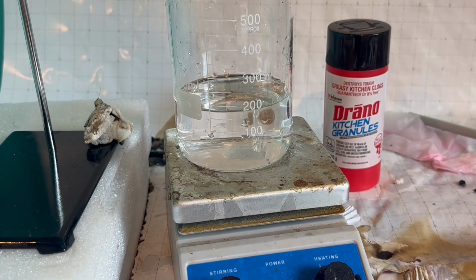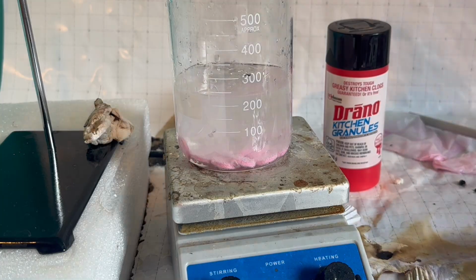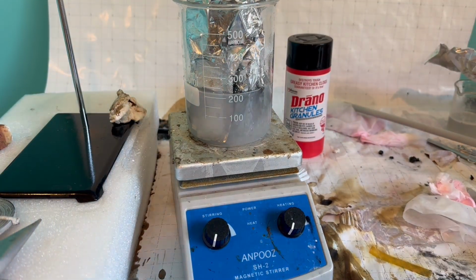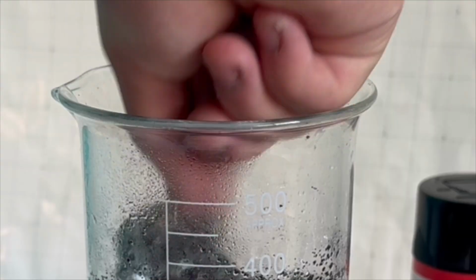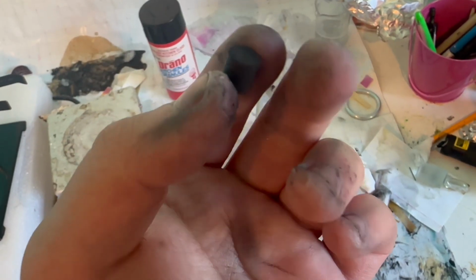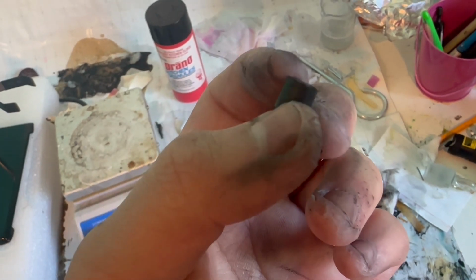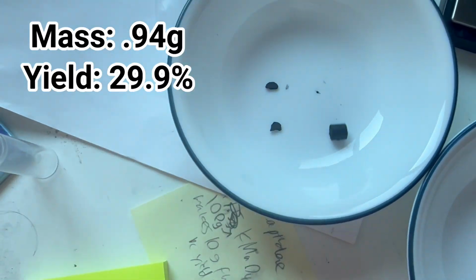Time for the second batch. I dissolved the pills in acid and filtered them once again, but this time I'm going to be using aluminum foil instead of zinc granules. After squishing everything down and waiting a while, you can see that the aluminum has turned very dark from the formation of bismuth. After pressing everything into a tablet again, I find that the mass is 0.94 grams, leading to a much more respectable yield of 29.9%.